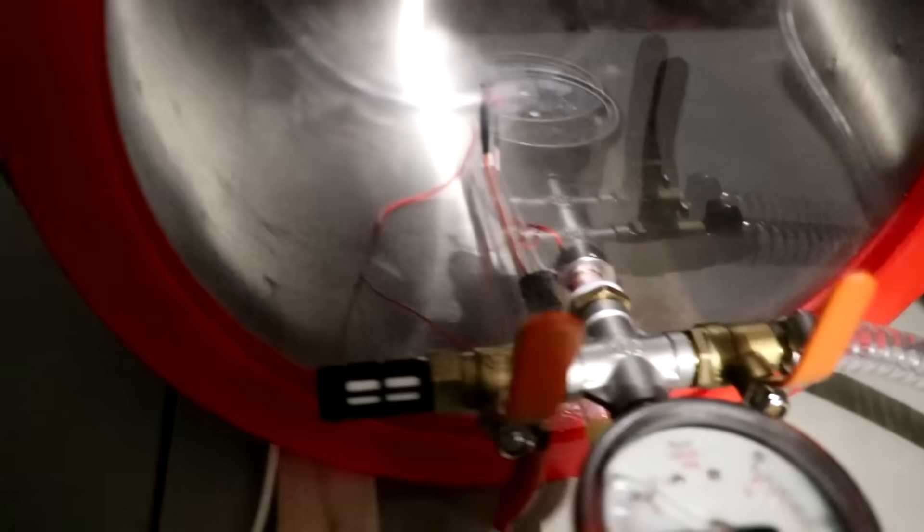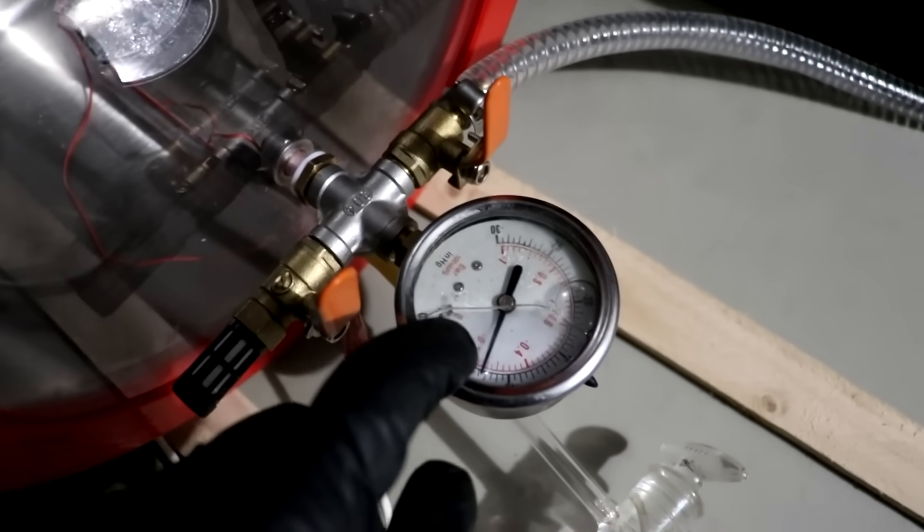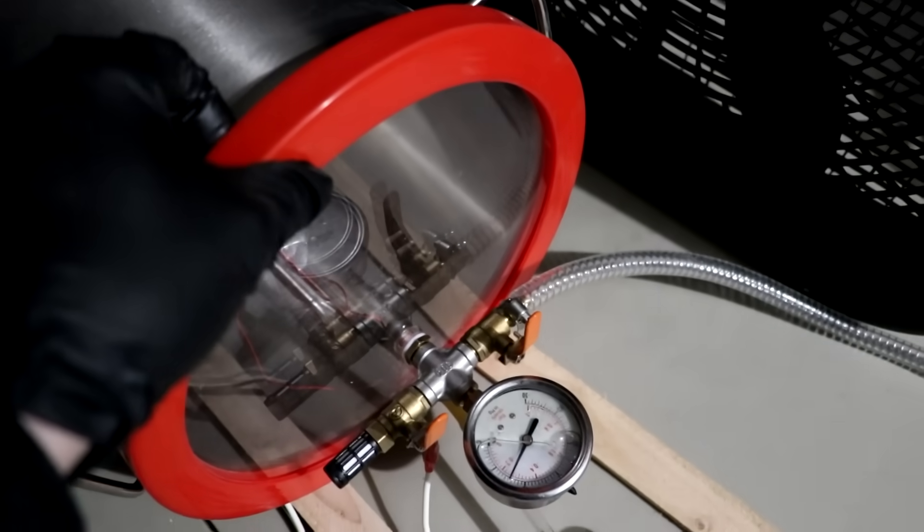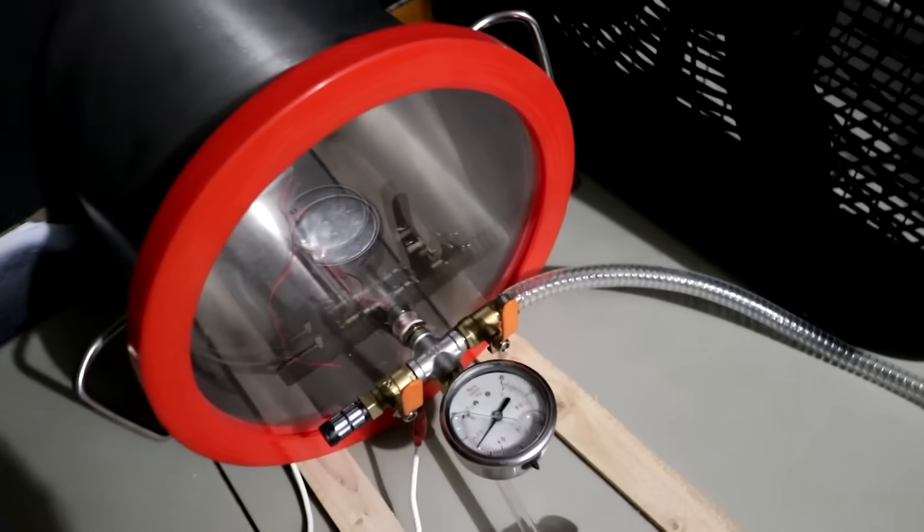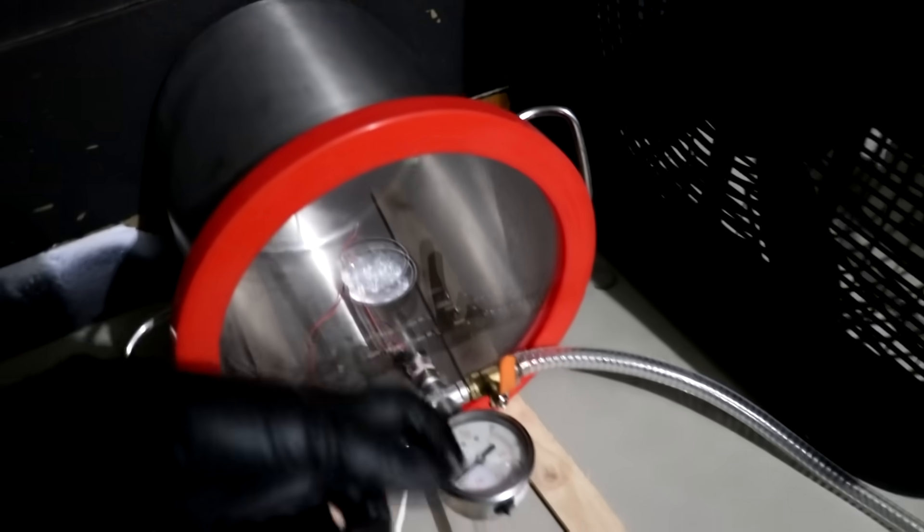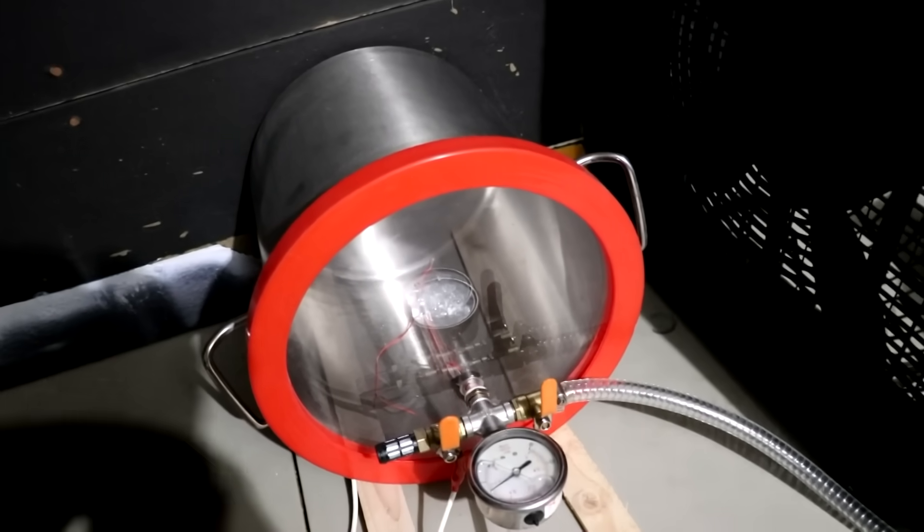So you can see, I've got a tube going in underneath of this, right there, which narrows down to a little nozzle where I have a sparker for ignition. You can see on this gauge here, I've got a slight vacuum pulled. That's so the lid of this chamber does not pop off. So, let's first run the propane into the chamber which still has mostly air and let's see how the flame looks.